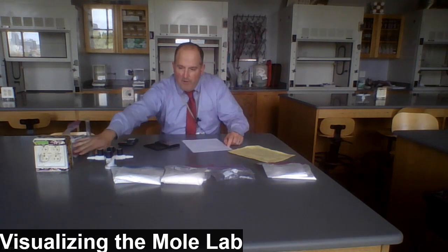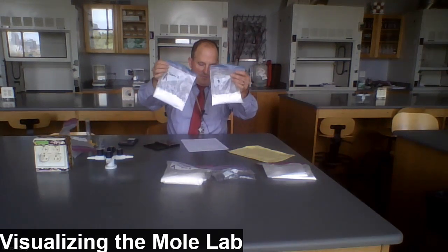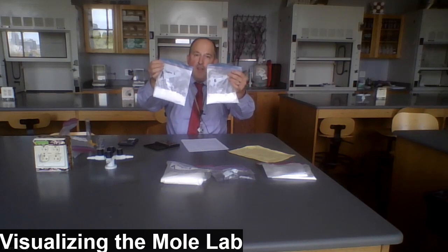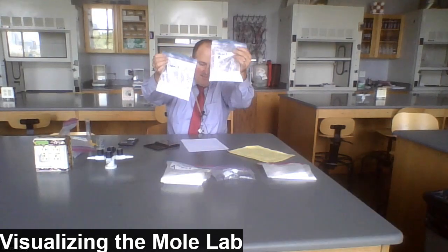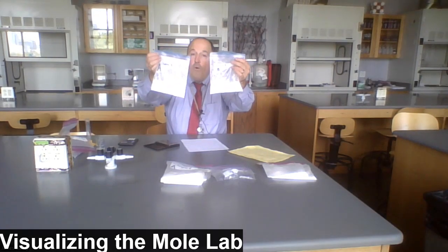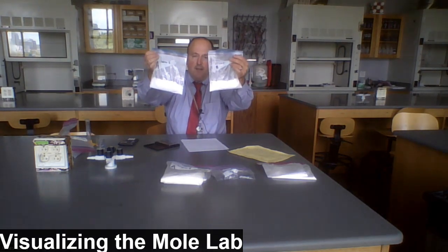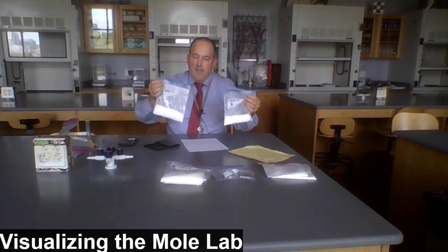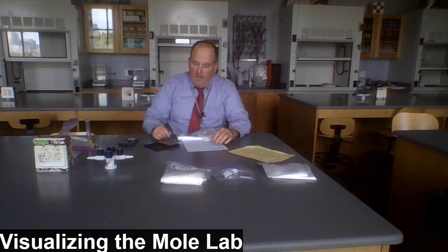On to station 3. Again, we're going to use samples that are 1 mole each. This time we're dealing with white powders. Sample A and sample B. We don't know which is which, but one of them is calcium hydroxide and one of them is calcium carbonate. Ooh, okay. Now, we have to figure out which one is which. And the way to do that is to think about their molar masses.